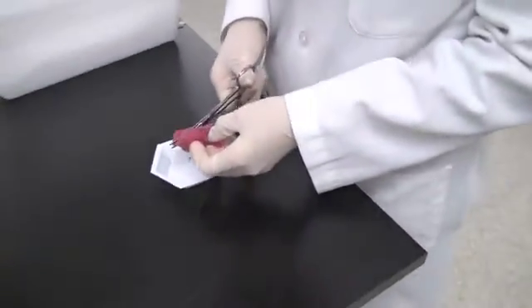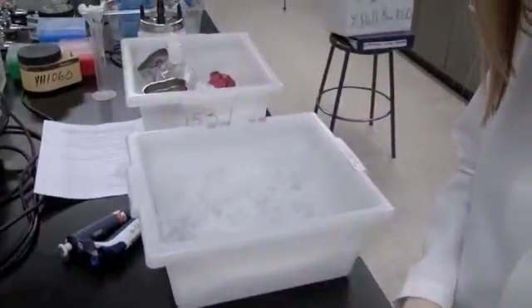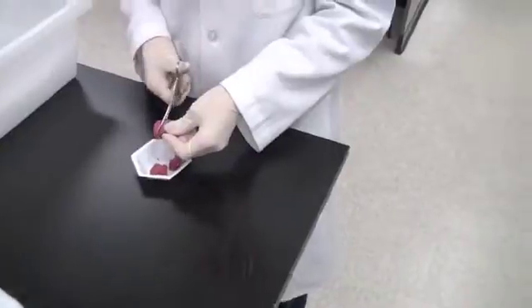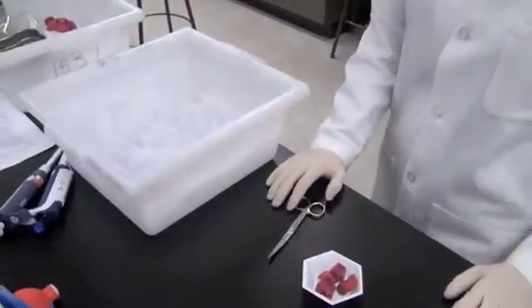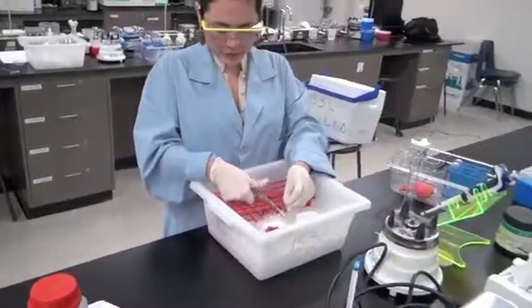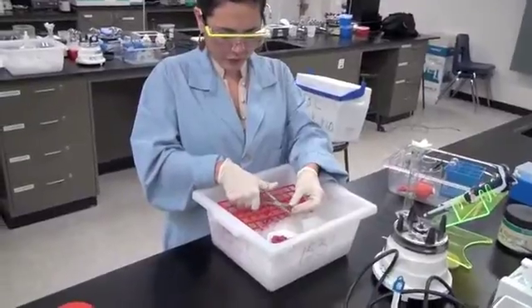If one had a choice, it would be wise to avoid pieces that have excessive marbling. That would mean less muscle tissue and more fat and connective tissue. That would make it difficult to cut out the non-muscle tissue, leading to a lower yield of enzyme. Ooh, aren't those pieces too big? Yes, they are. Biochemist Dicer cuts her meat into smaller chunks both to easily remove the non-muscle tissue.